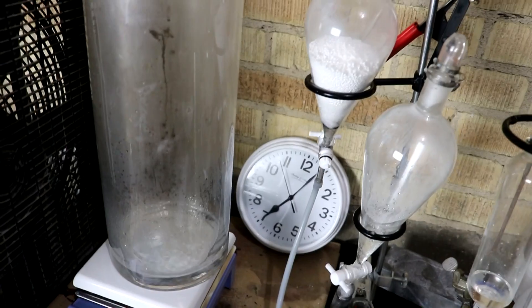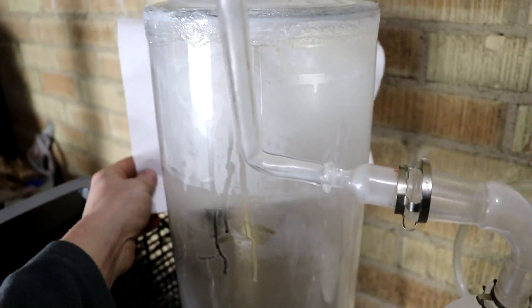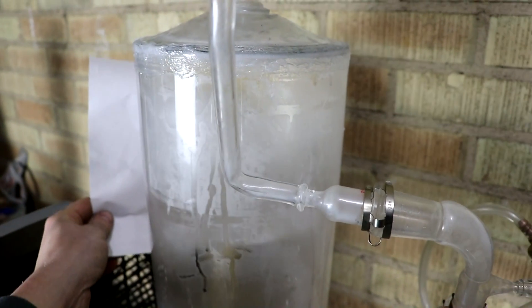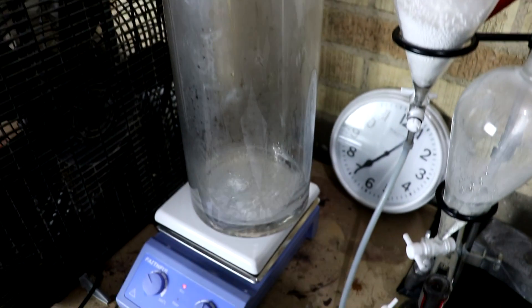There we are. It's been just after one hour. If we take a piece of white paper here, you can see that the chamber is slightly brown. Especially up near the top there.